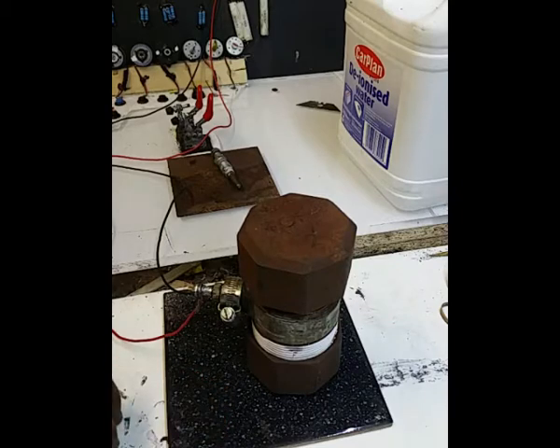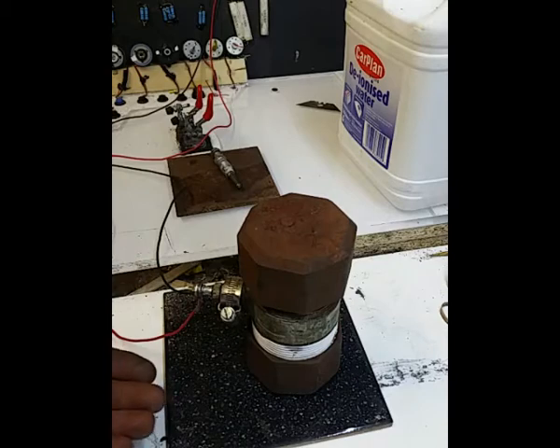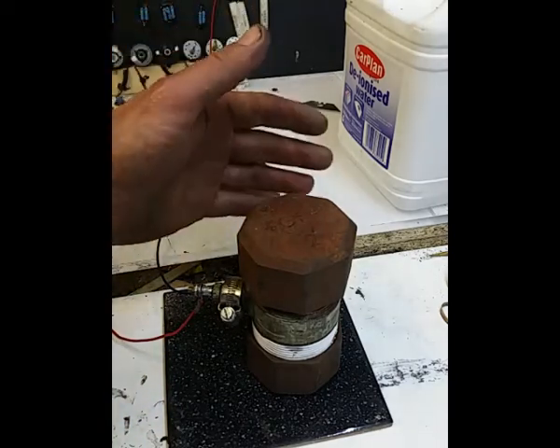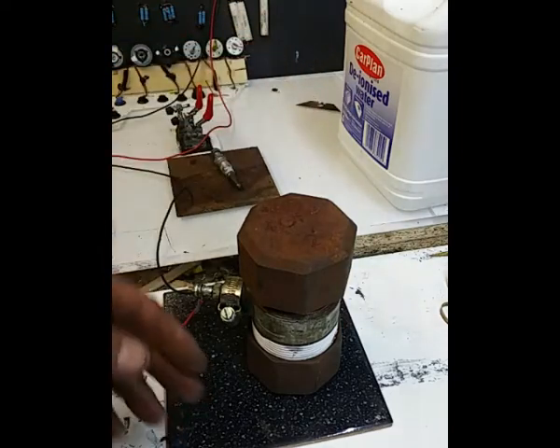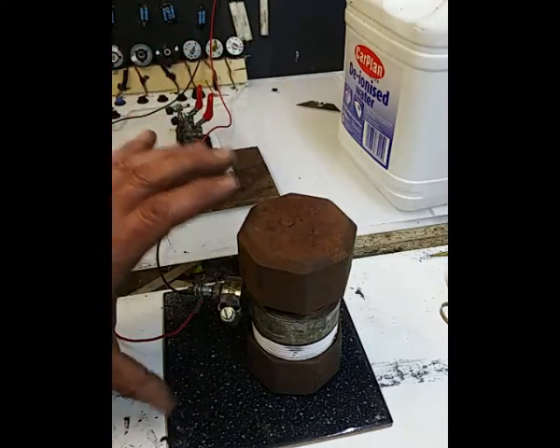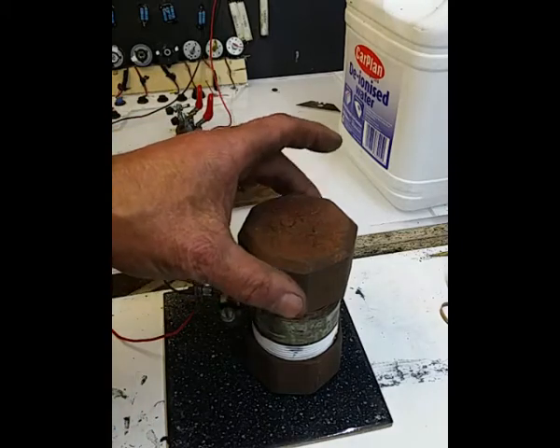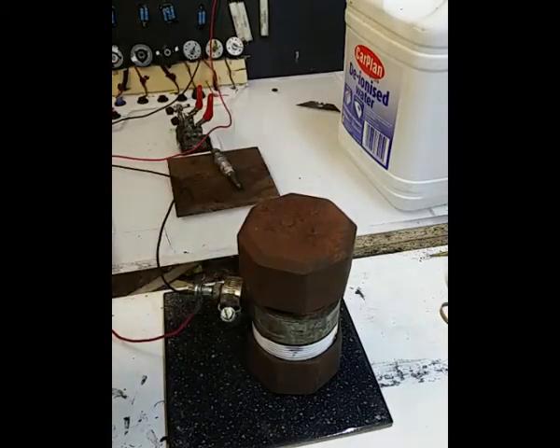And at the end of the day, this is internal heat, and with your oven you start with external heat to get the internal heat, but this is just hopefully a quick way of getting that internal heat. Yeah, that's hot now.